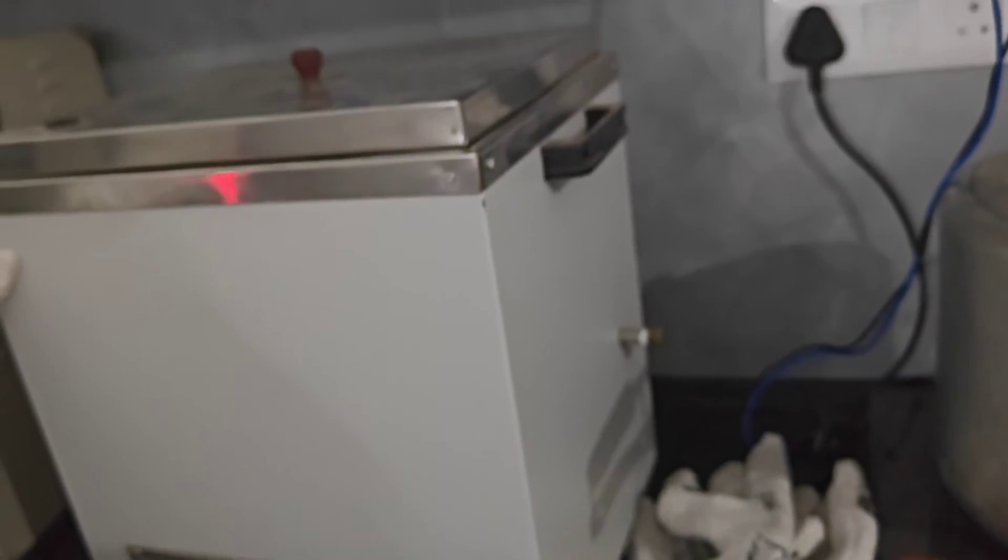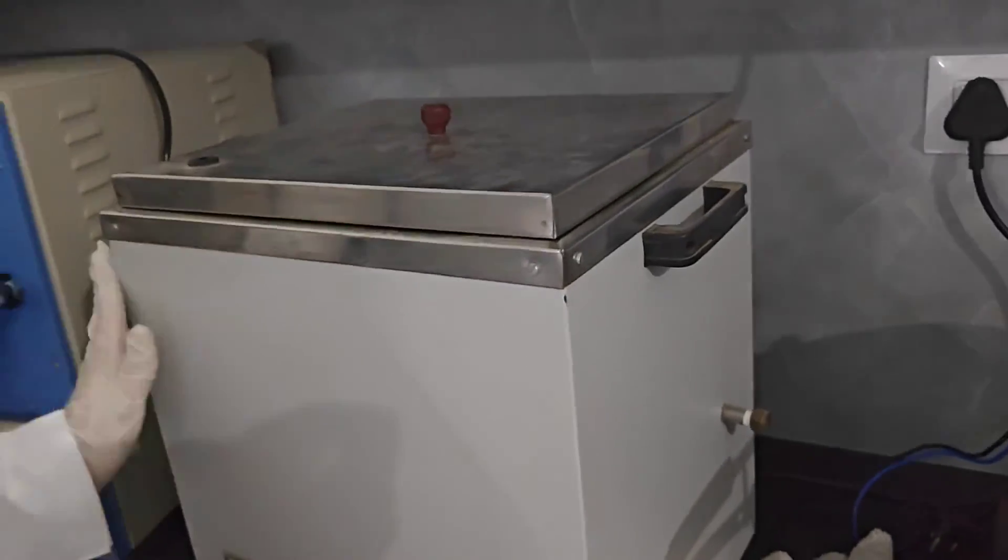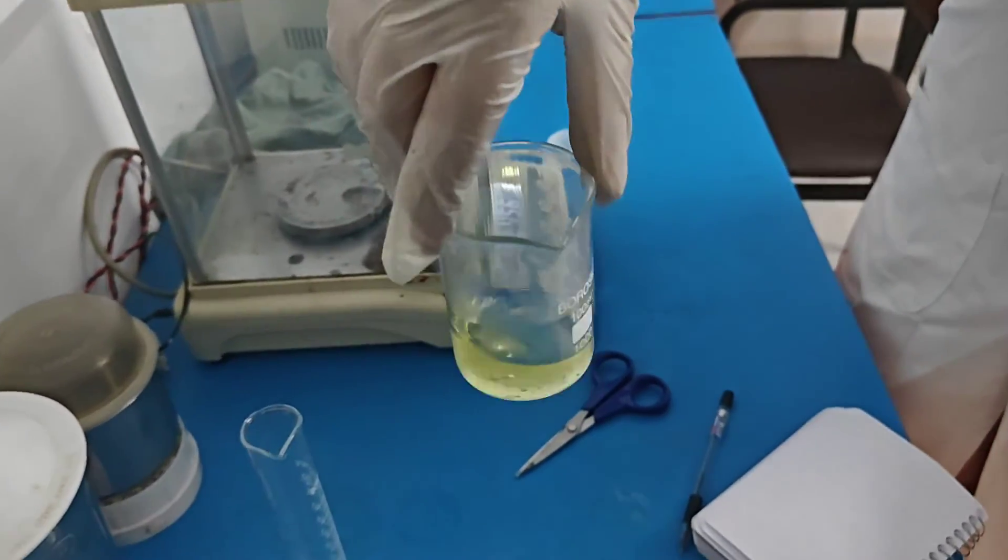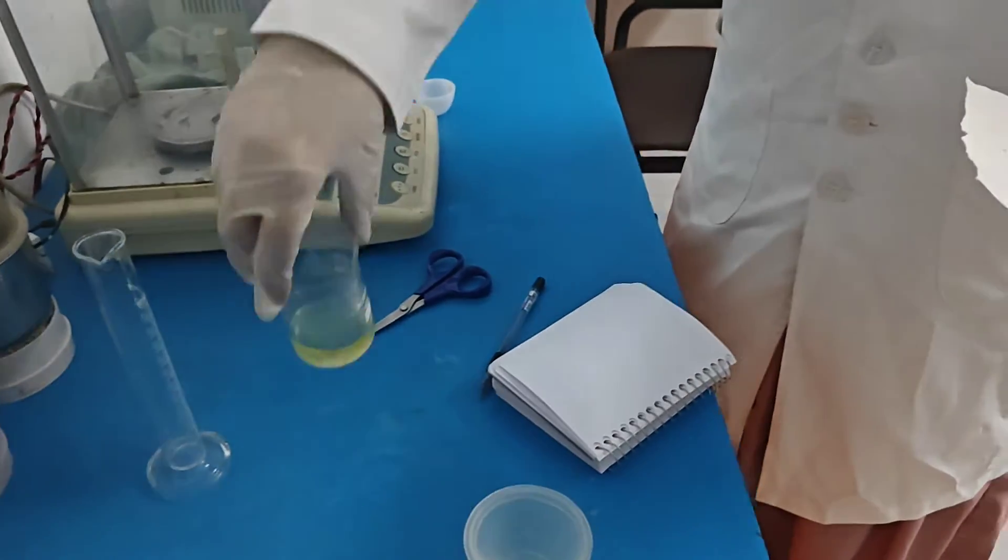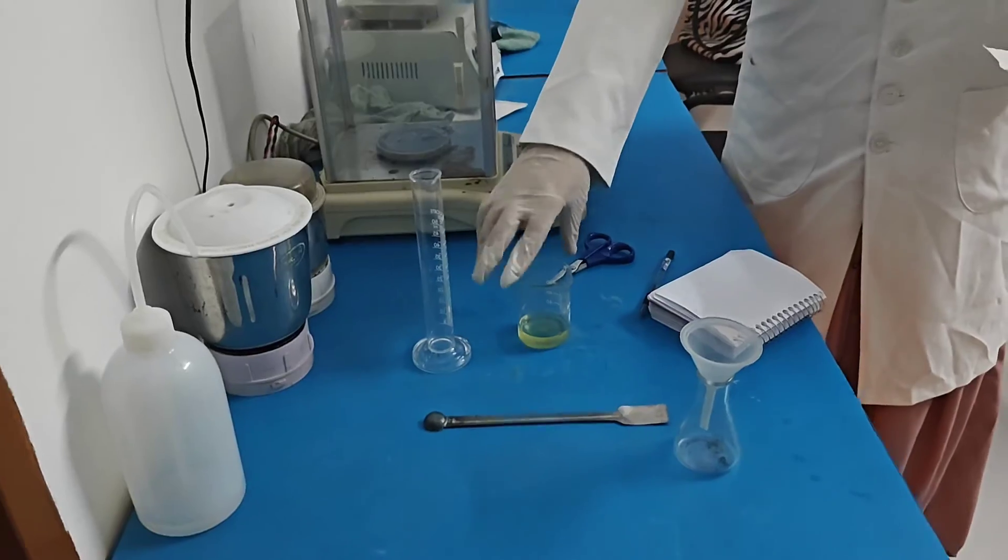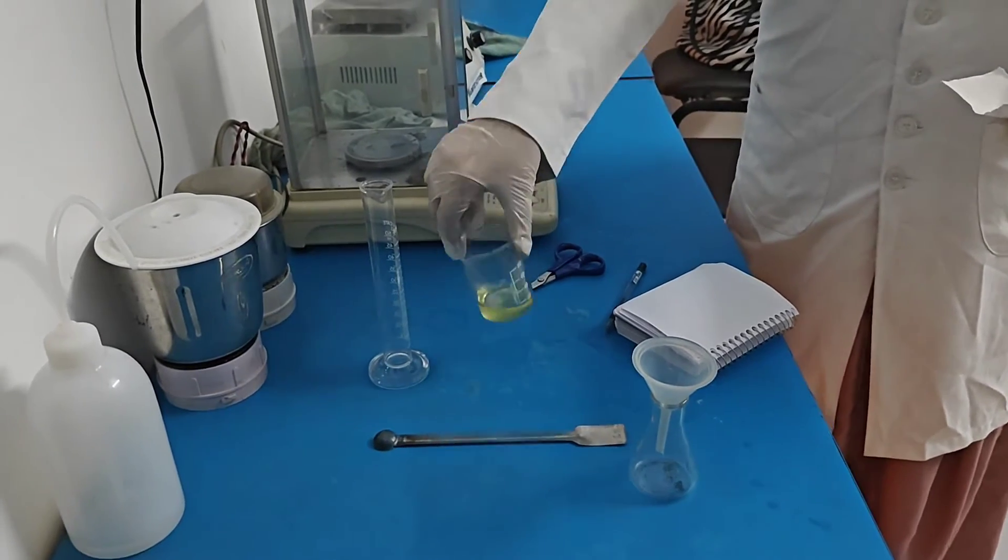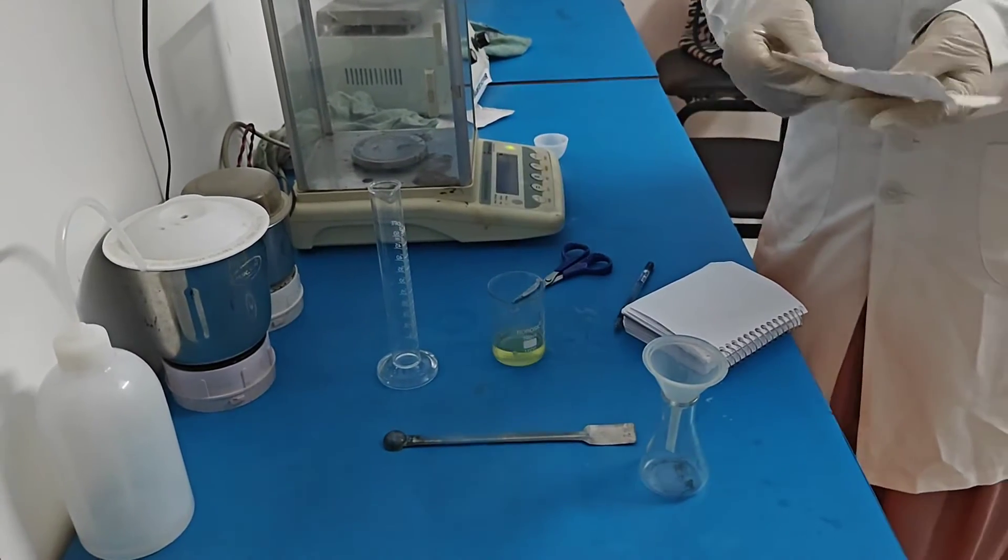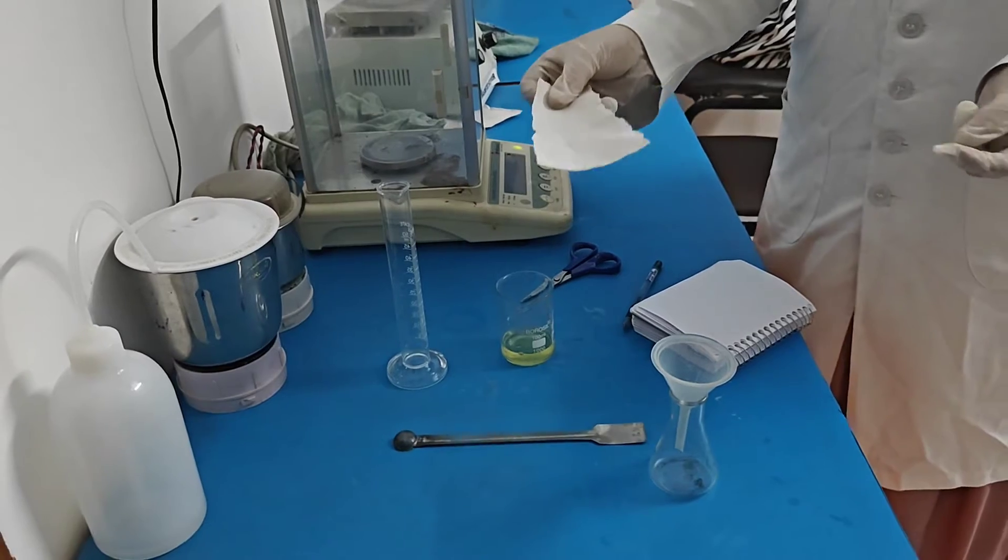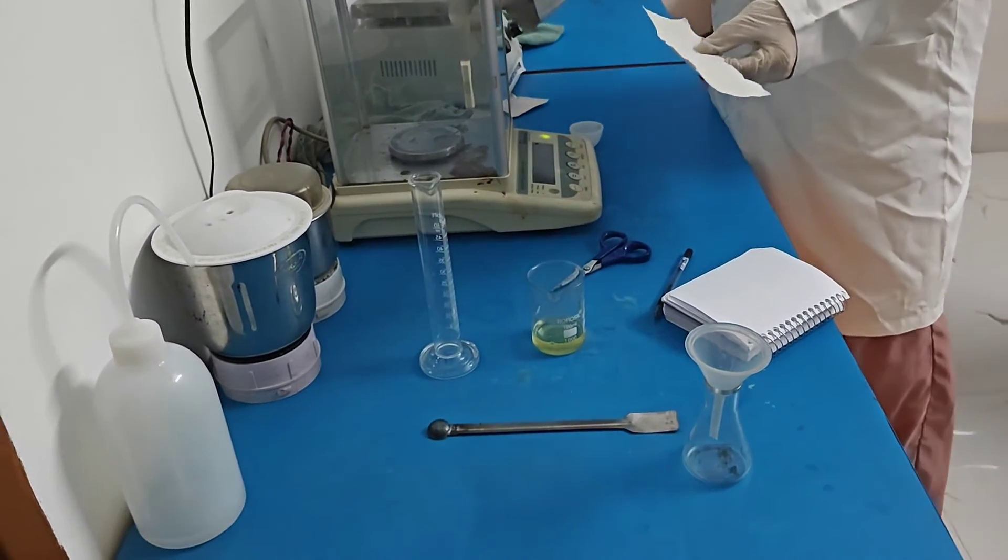After 10 minutes, filtration should be performed. After boiling the concentrated HCl, I am going to filter it. Before filtration, I am going to weigh the filter paper.